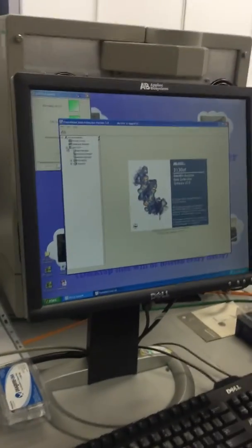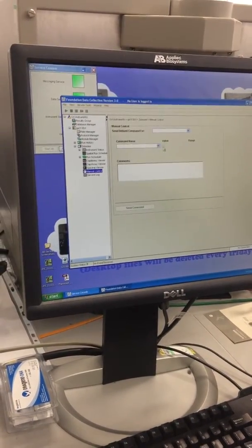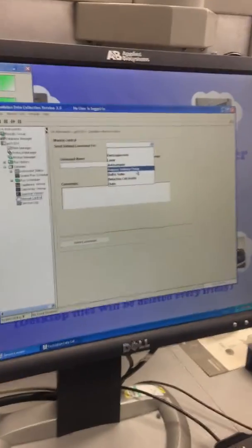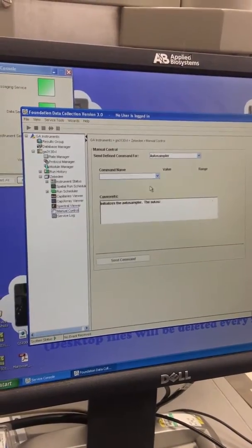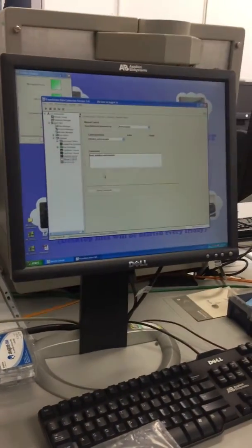Yeah. Just to show you the link works. Manual control. So if I say get it to move autosampler, initialize, it should send it a command. Oh, you can hear it, can't you? Yeah, we used it about a month ago, really nice, but it's for genotyping, not sequencing.